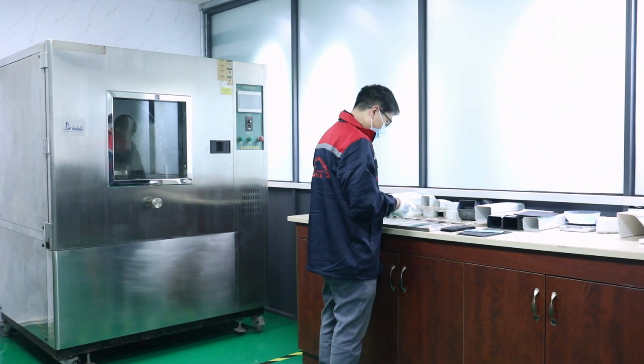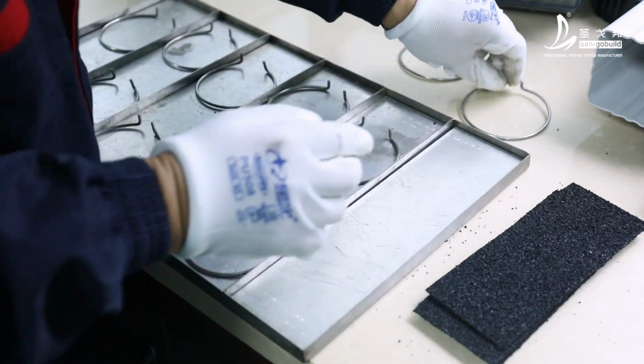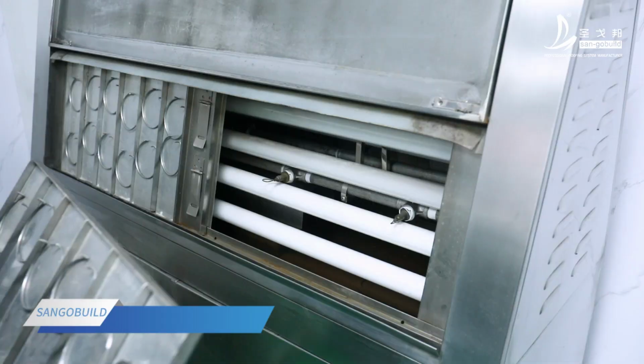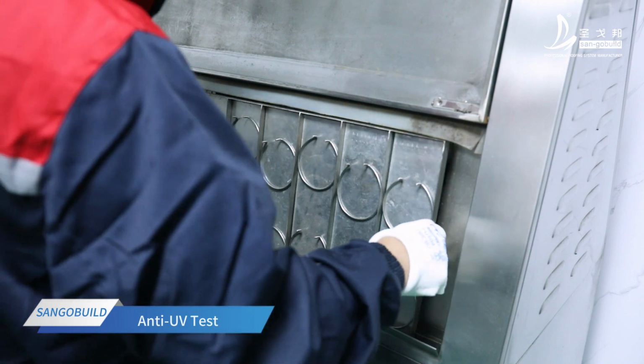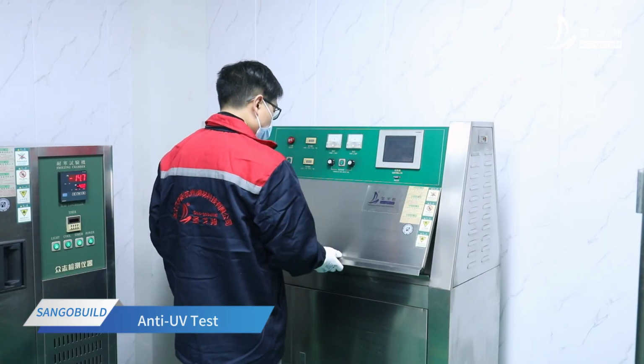Send the cut sample to the stone-coated roof tile laboratory. The laboratory technician carries out a UV-accelerated weathering test on the sample. Put the sample into the machine. Start the machine for testing.